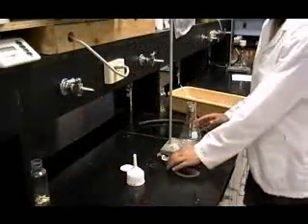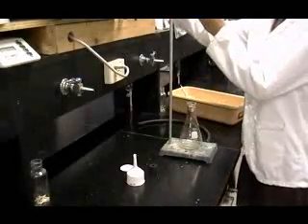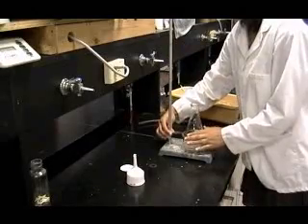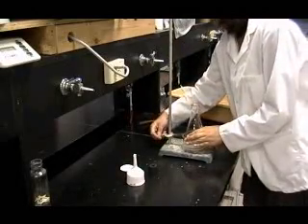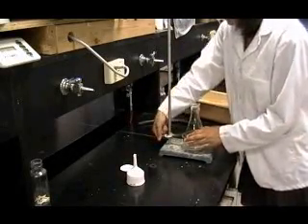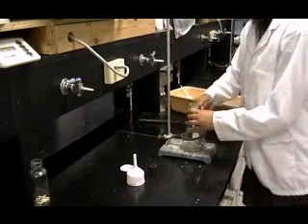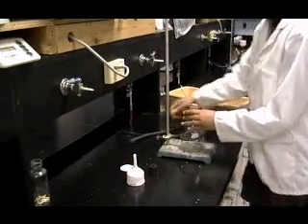The aspirin will be isolated by vacuum filtration. To assemble a vacuum filtration apparatus, attach one end of a length of thick walled vacuum tubing to the side arm of a vacuum flask and the other end to an aspirator on a water tap. Support the flask on a ring stand so it does not tip over.